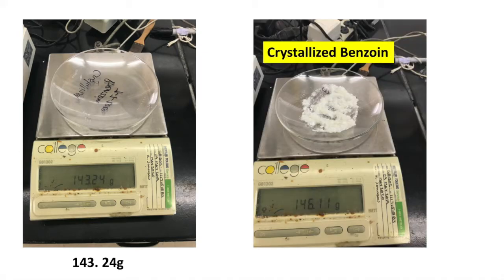Here's the watch glass empty that I put the crystallized benzoin on. It weighs 143.24 grams, and the crystallized benzoin is here, on the same watch glass. It comes in at 146.11 grams. So pause the video now and write in your reaction table the calculated mass of final crystallized benzoin.